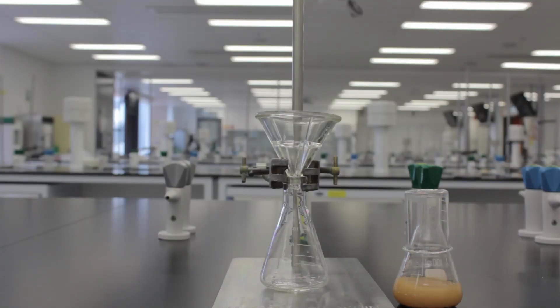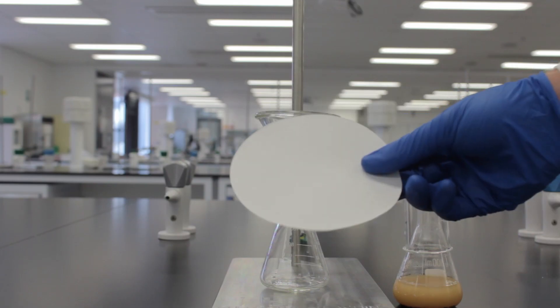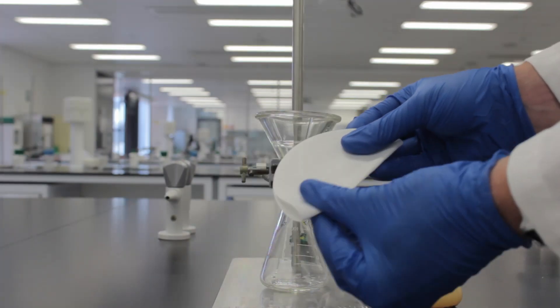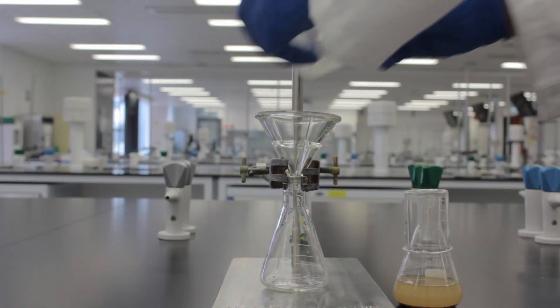While you're waiting, set up your gravity filtration using a 100 ml conical flask, a glass funnel and a large filter paper. Flute your filter paper to maximize the surface area for filtration. Here's one we prepared earlier.